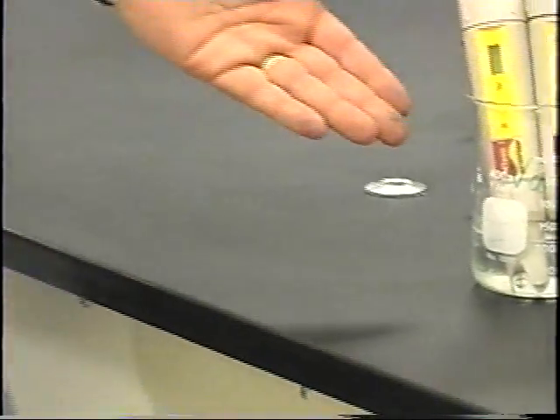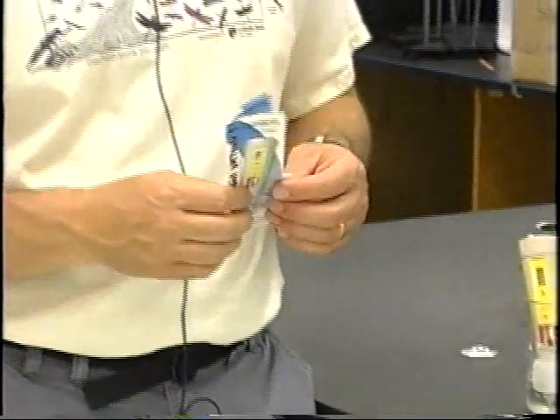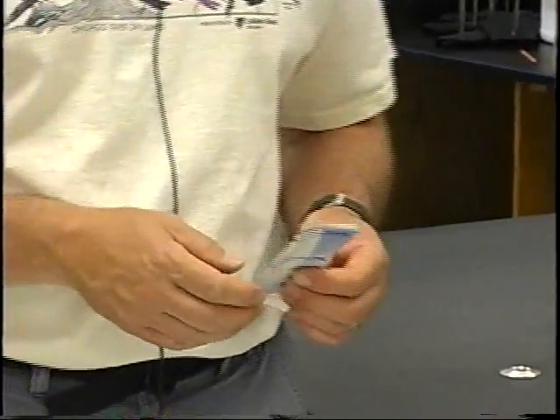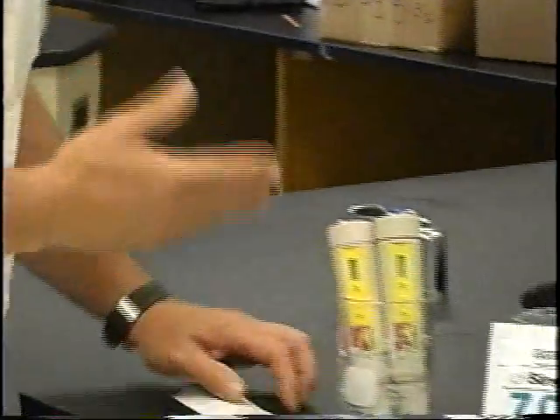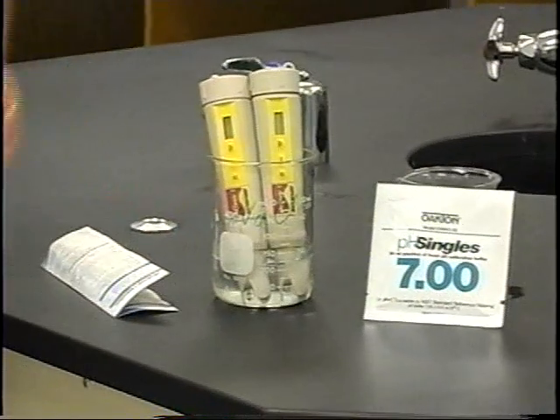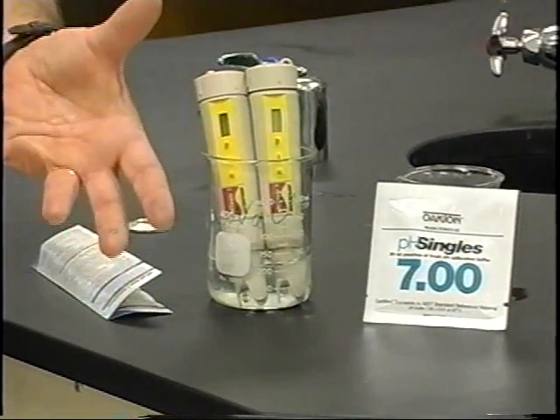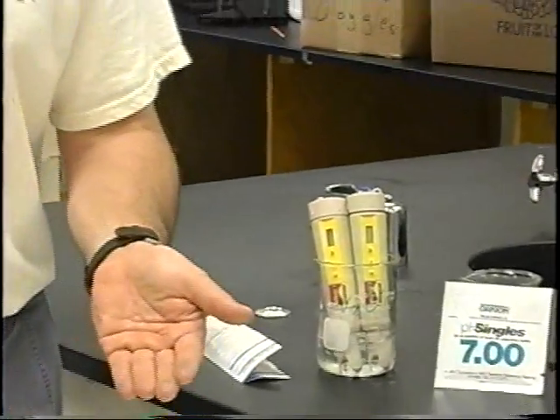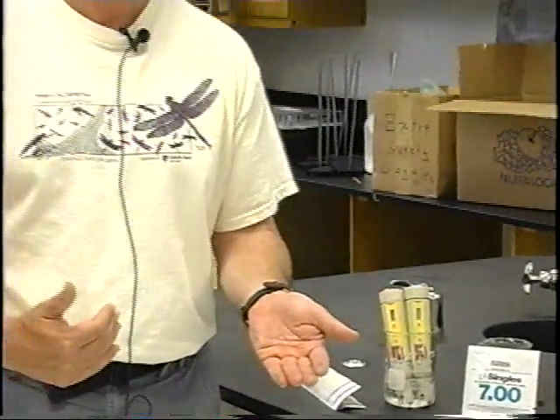Okay? Well, this has been sitting in the water for a couple of days now, so it's in pretty good shape as far as being conditioned. But the next thing that you have to do before you go out is calibrate this. It's almost like if you're going to weigh yourself on a scale. If you step on the scale and the scale's reading 10 pounds below 0 to begin with, you're not going to get an accurate reading of how much you really weigh. You're going to say, hey, look, I weigh 10 pounds less. You have to set that scale exactly at 0 before you get on it.